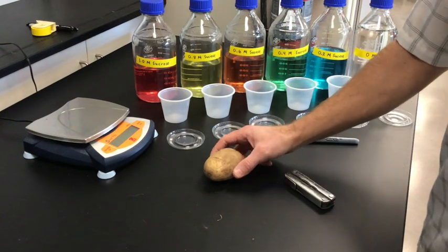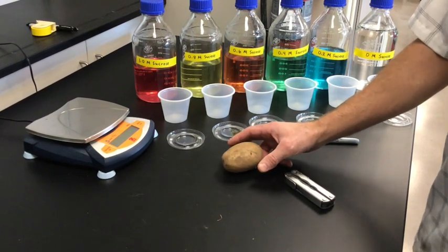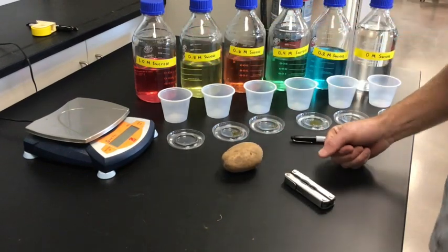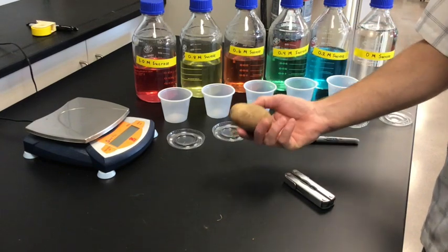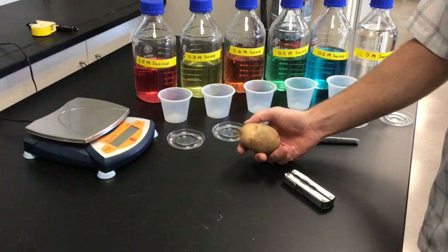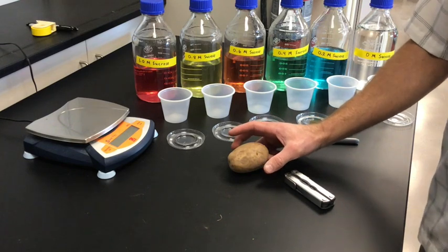Just to get a reminder of what molarity is — it basically deals with the concentration of the solute, in this case sucrose, dissolved in a solvent which would be water. The molarity of a potato cell would be a combination of a lot of different solutes dissolved inside the cell cytosol.